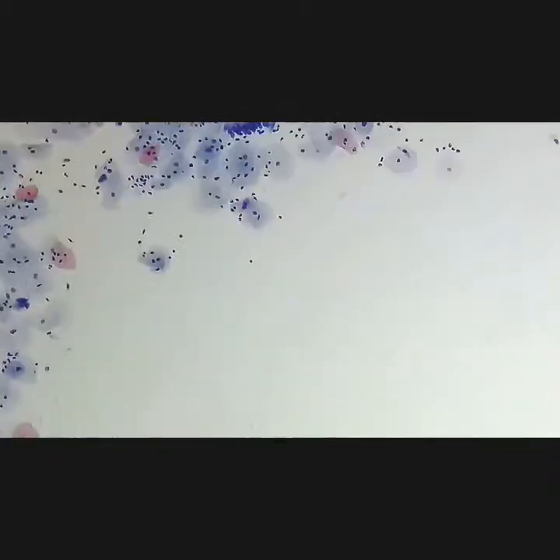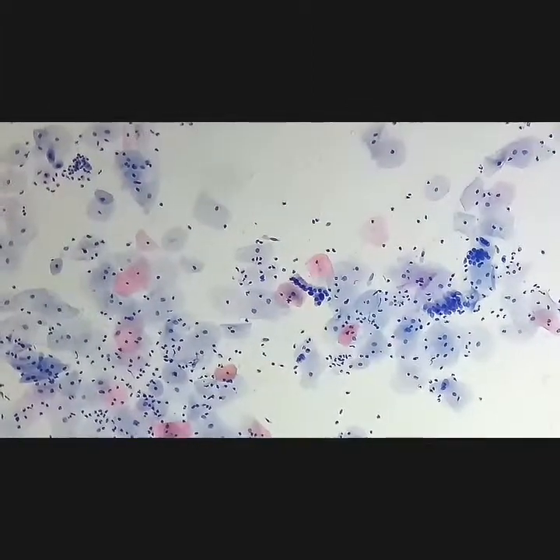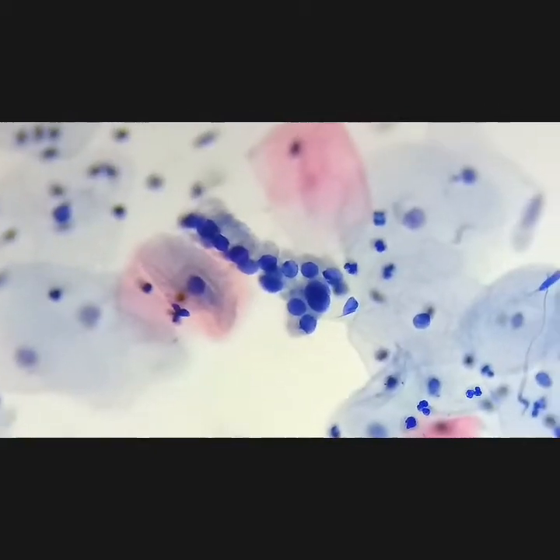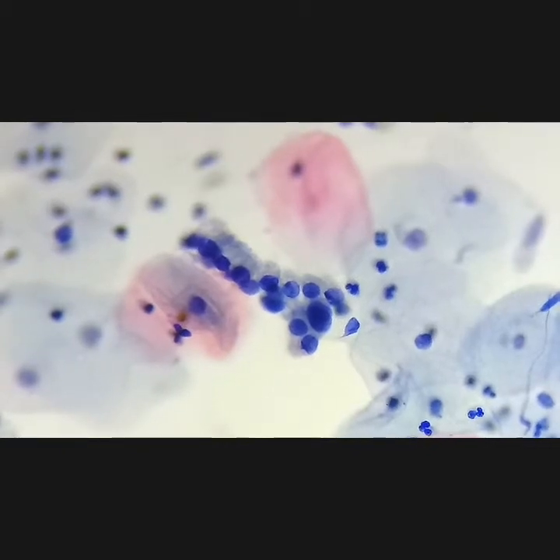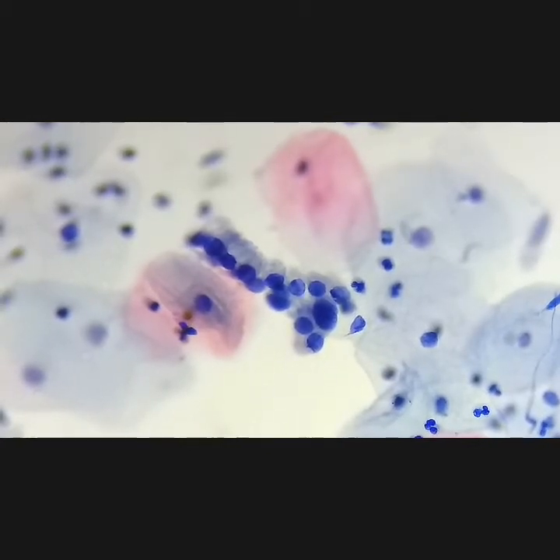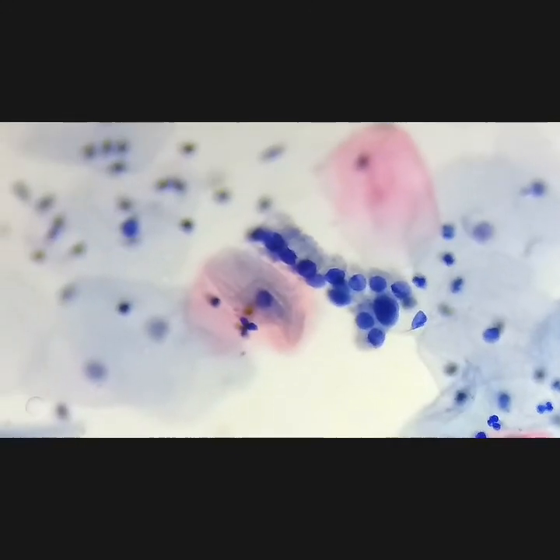Here is a very beautiful example of what I call the Indian hat pattern. The nuclei are polarized — they are soft, round to oval — and we have a large cytoplasm above. The glands are back to back, and the cells are back to back. A very beautiful example of the benign Indian hat pattern for endocervical cells.